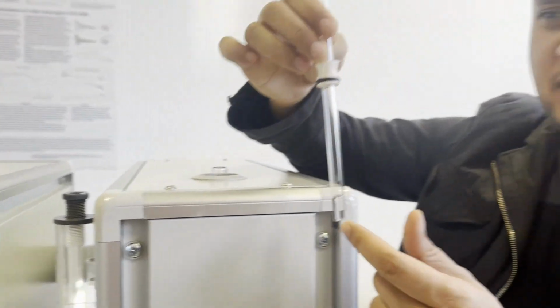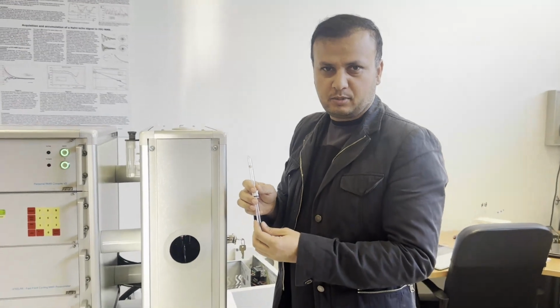Hello, I am Imran, engineer at Stelar. So today I will explain to you how you can use our instrument SMARtracer to perform NMRD experiments.